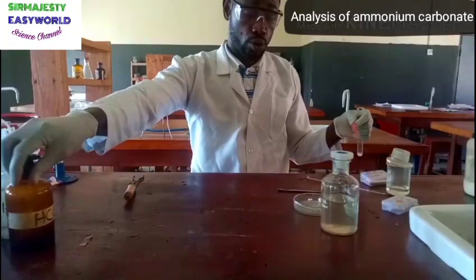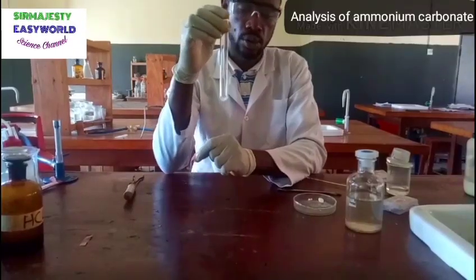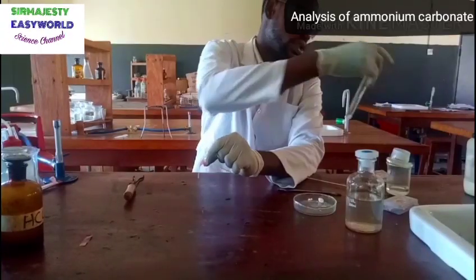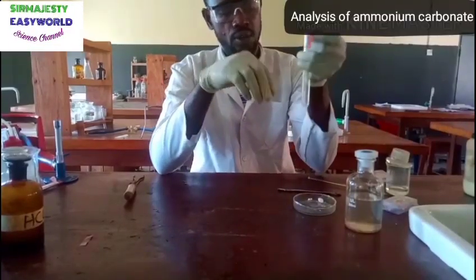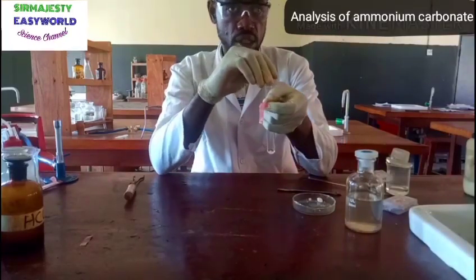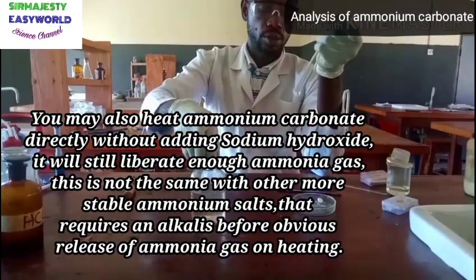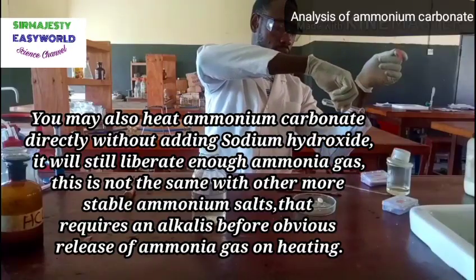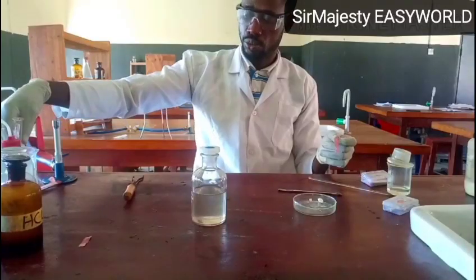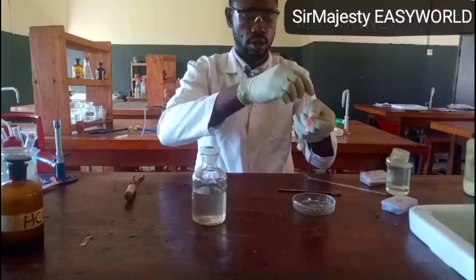So the experiment I want to do now, this step is where you are asked to add few drops of dilute sodium hydroxide to a solid sample, or to half a spatula of sample C. Remember, sample C is ammonium carbonate. They will tell you to add few drops of dilute sodium hydroxide to sample C, followed by gentle heating. So this is my sodium hydroxide. Let me use another dry test tube.